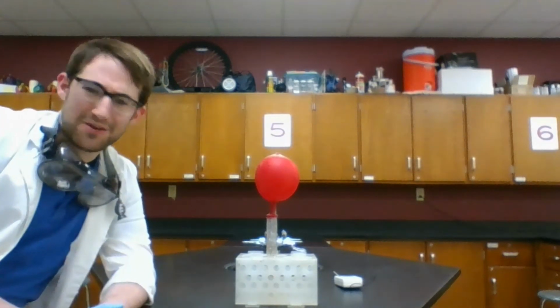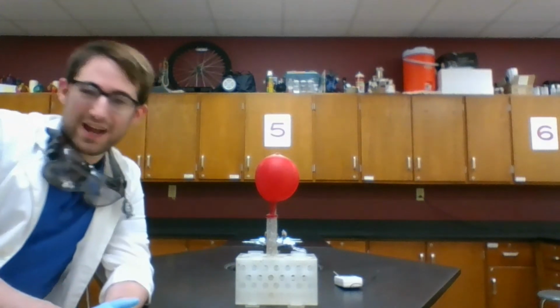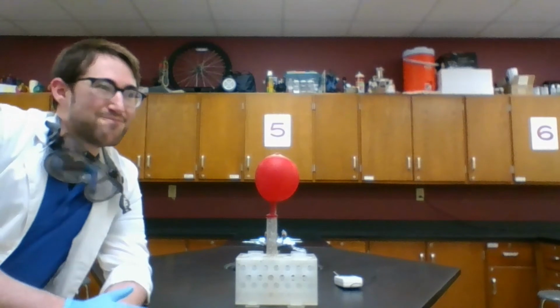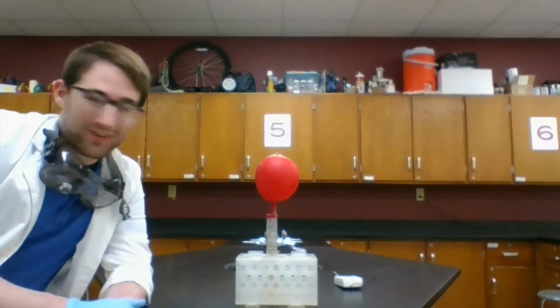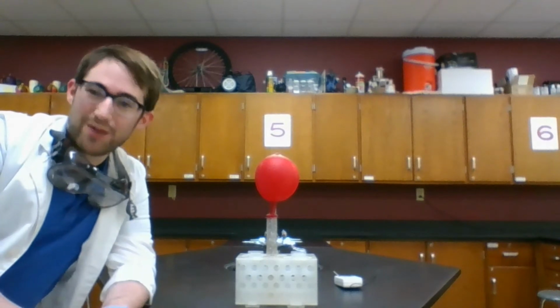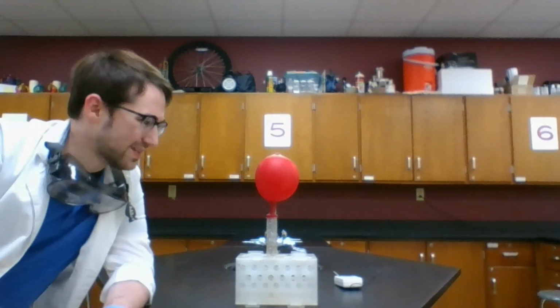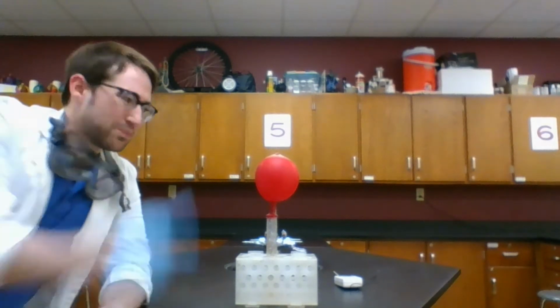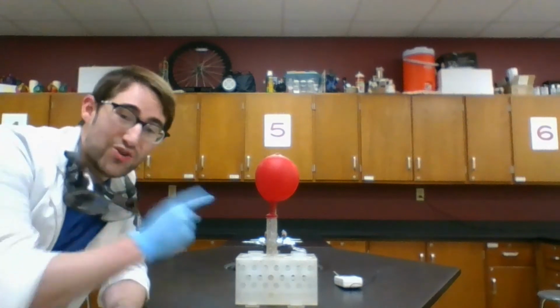But in this case, it got hot, but not really hot enough to boil the liquid down here. If it did, then that would have to reach 100 degrees Celsius, right? That's the boiling point of water. Hydrochloric acid's boiling point is probably a little bit different, but it's got to be pretty darn close since it is dissolved in water. So what this tells us is we're going to get gas from something that wasn't originally there. Okay, this is a new substance.